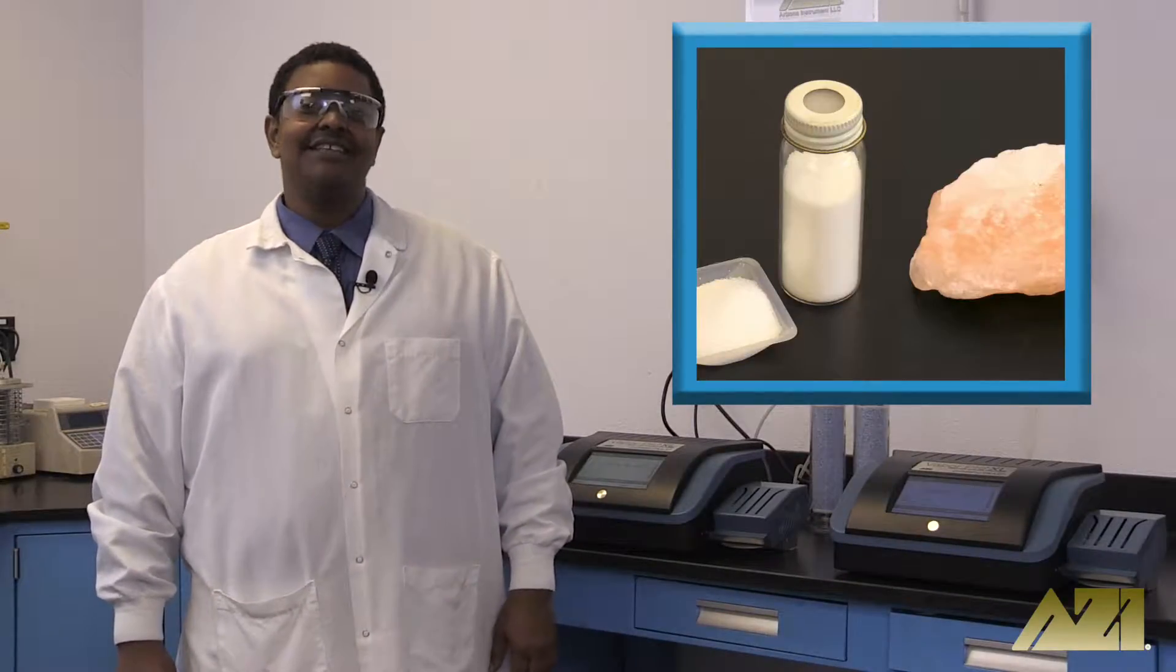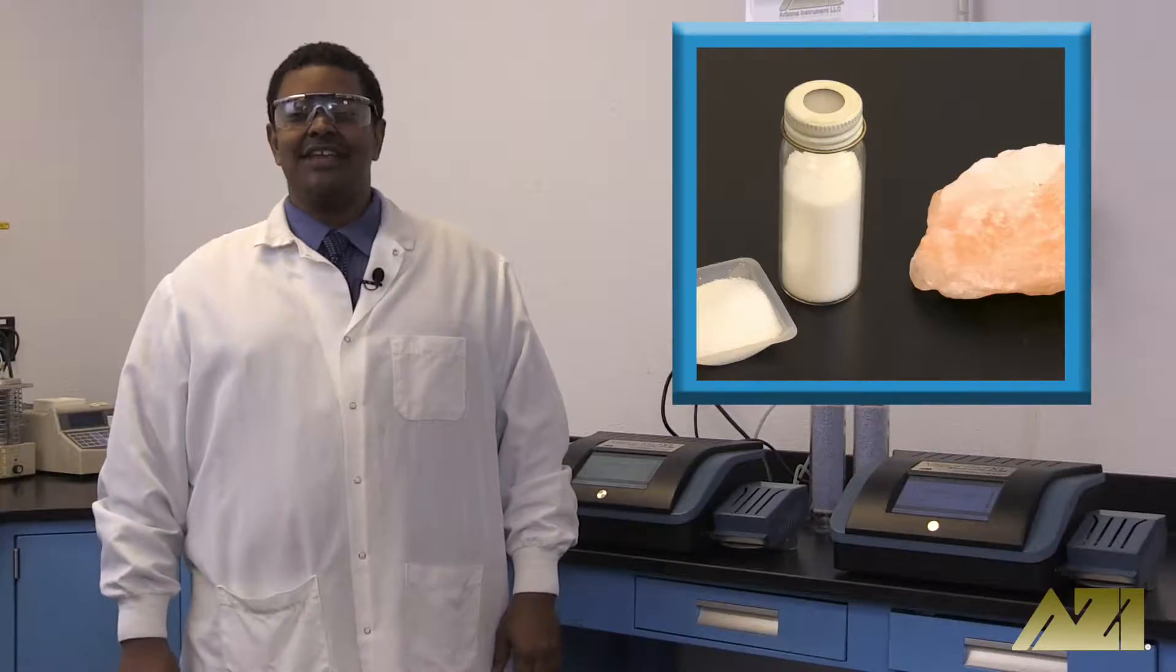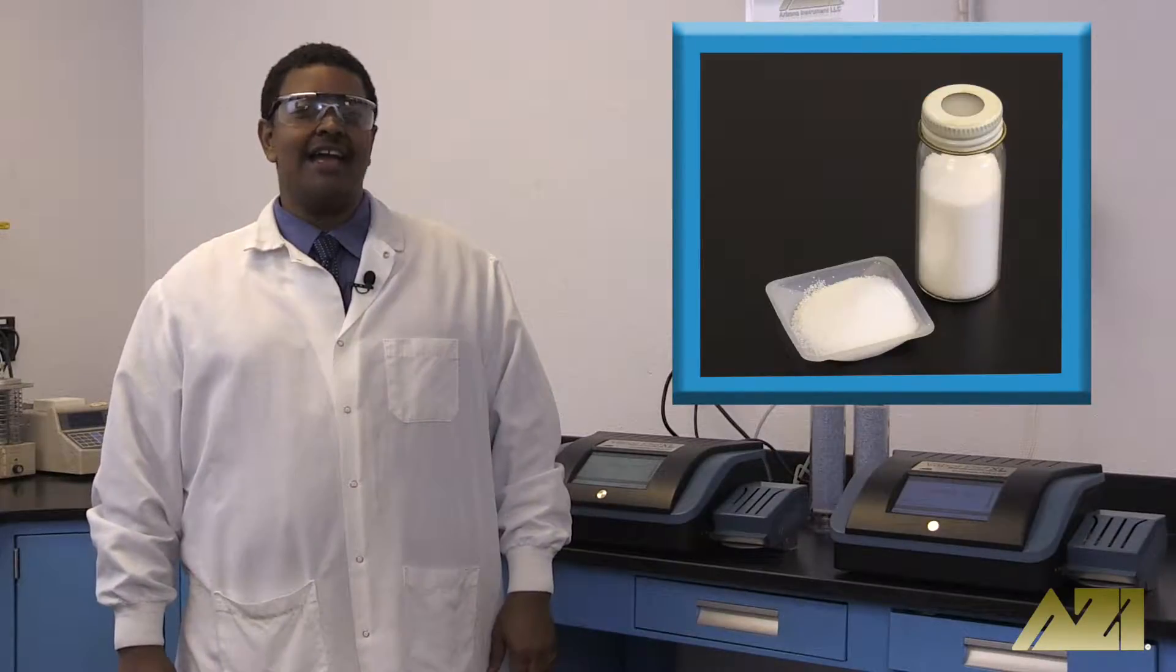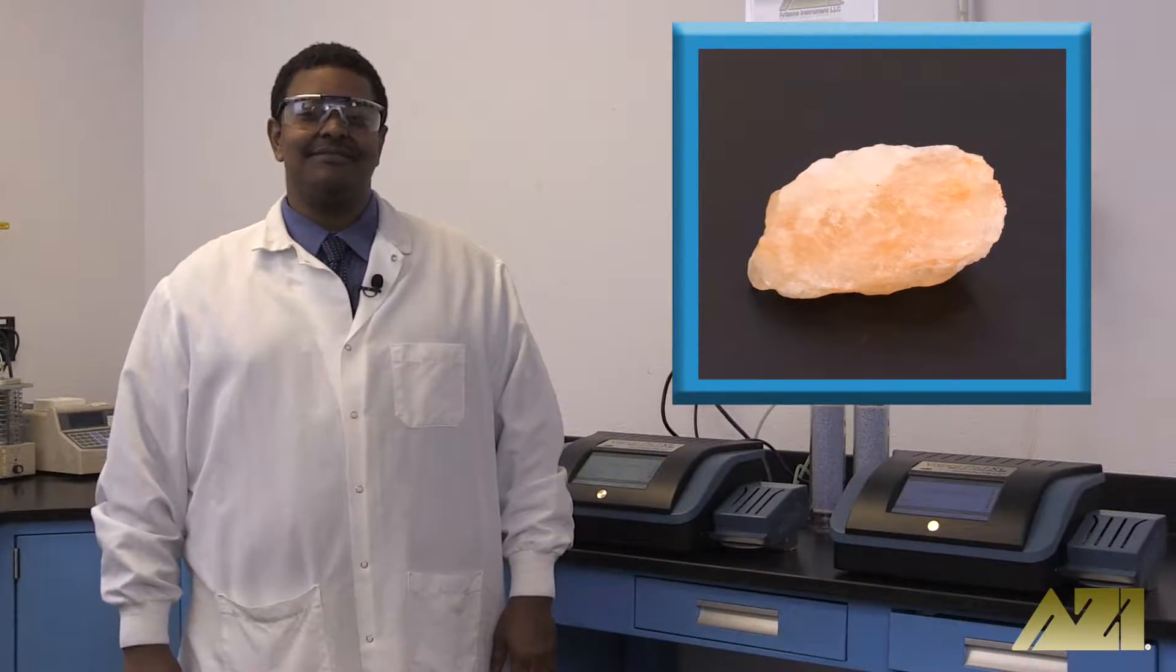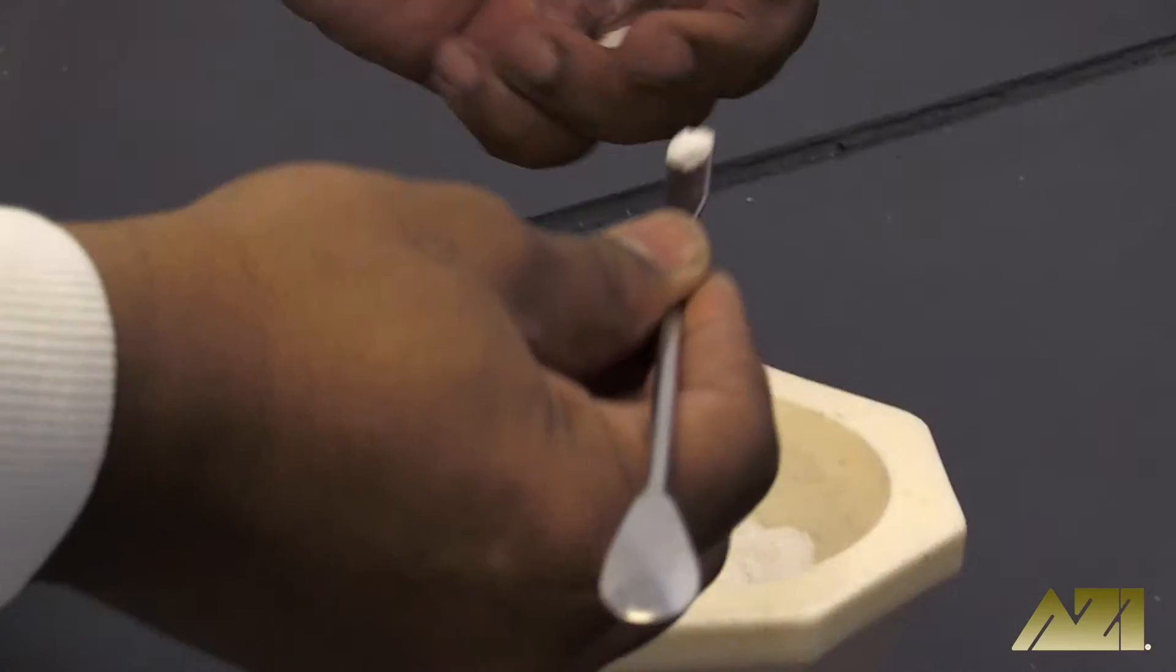Today we're testing salt. Which do you think has more moisture, regular iodized table salt or pink Himalayan rock salt? Let's find out. Testing for moisture in salt is essential.